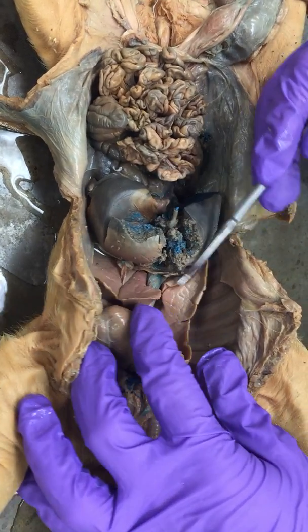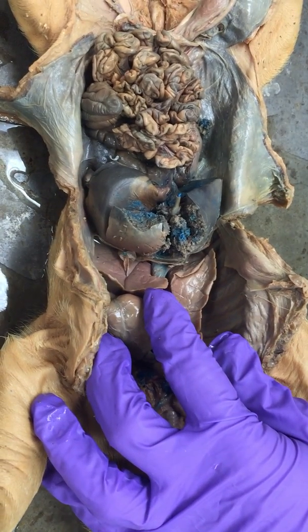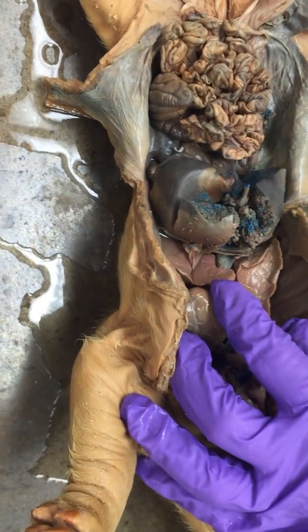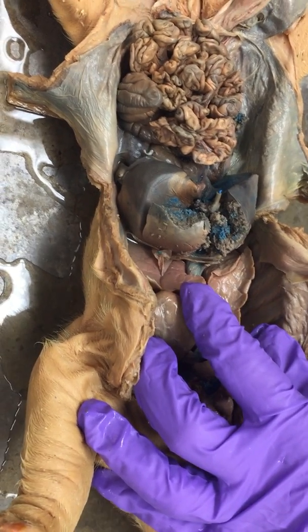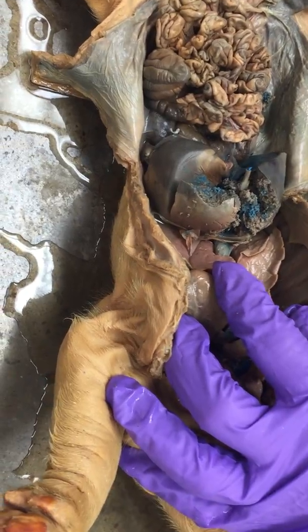And the caudal vena cava, remember, delivers blood, and we'll talk about this in more detail, to the right side of the heart, to the right atrium and then to the right ventricle. Well, in an air-breathing infant, blood from the right ventricle would be pumped to the pulmonary circulation. But you can't use your lungs when you're a fetus, so that blood is shunted.